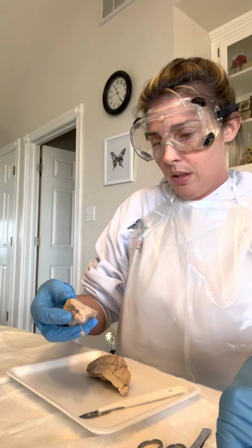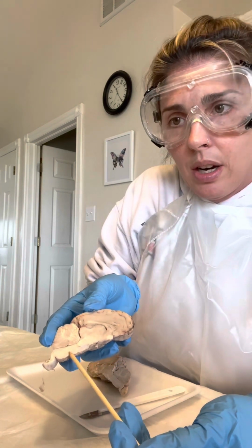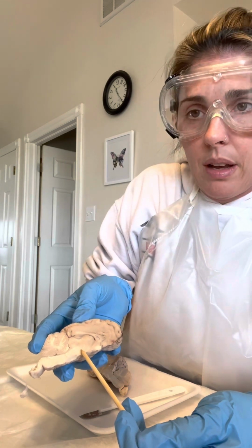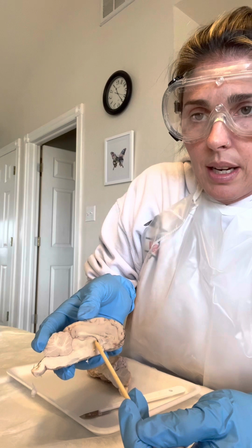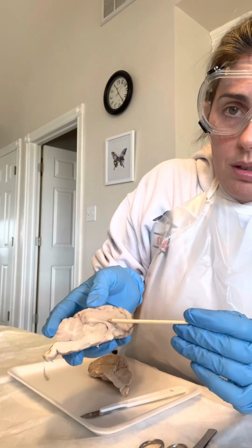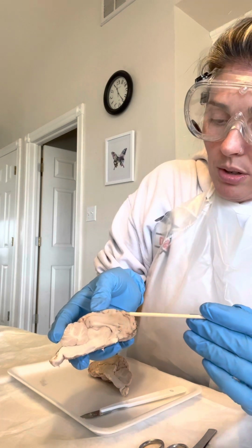Okay, so again, we can see this a little bit better. Right here is our spinal cord, and then there's a little area right here. This is the medulla, and then a little rounded area is our pons, and then we have the hypothalamus, which is right here, and then we have the thalamus up here, the little rounded area. This little elongated area is the corpus callosum that has bundles of fibers called axons that connect neurons in the two hemispheres.